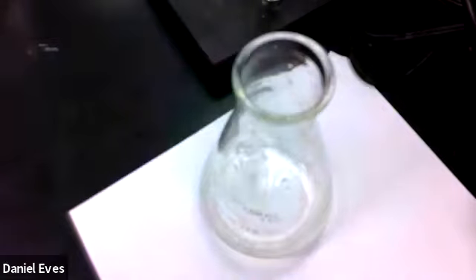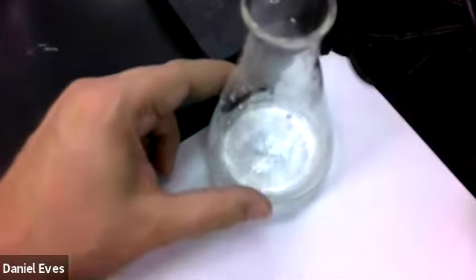Okay, now that we have had a chance to go and measure out an acid, so we have an unknown acid here, and we were instructed in our lab to measure out between 0.2 and 0.4 grams. And so in this one, I have put my 0.2 grams of an unknown acid. This is a monoprotic acid, which means it has one hydrogen. So we're going to go ahead and record the titration of this.